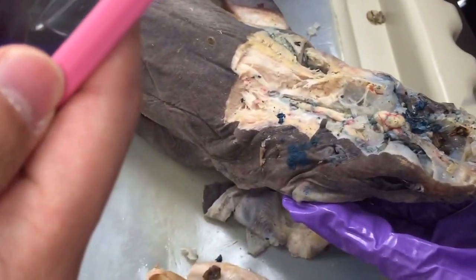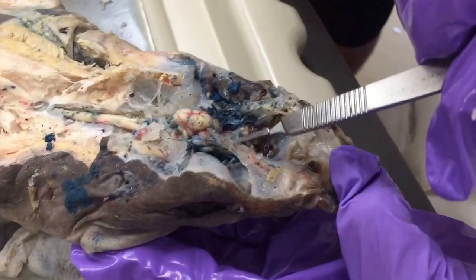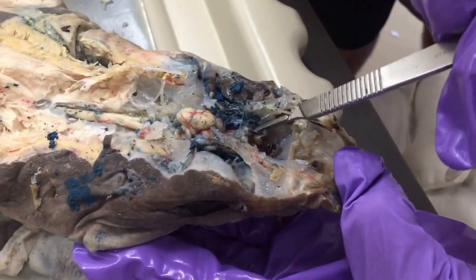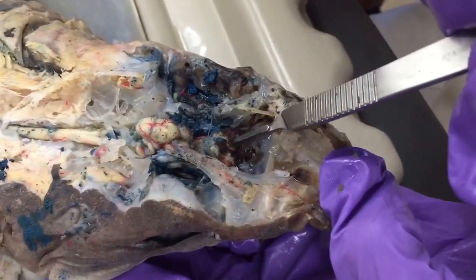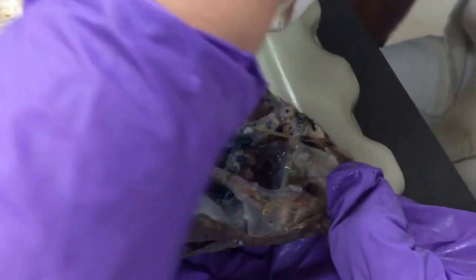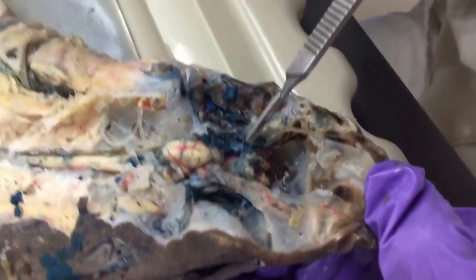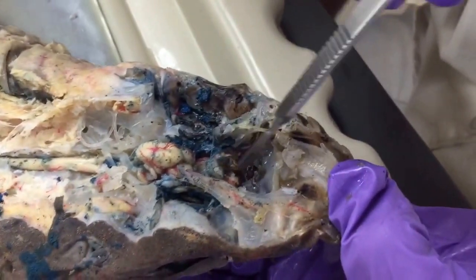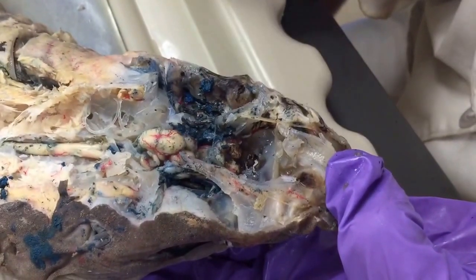Okay, now we'll start on the main parts of the brain. So olfactory tract runs back here to these two structures here, which are your two cerebral hemispheres. And keep in mind that these cerebral hemispheres are much, much larger in the mammalian brains, like these guys here. So we've got two really large cerebral hemispheres and the cerebellum back here. Whereas in the shark, you have your cerebral hemispheres here and your cerebellum here, which is larger in relation.